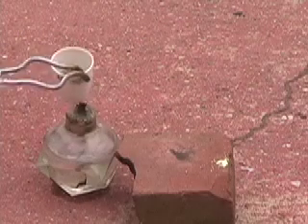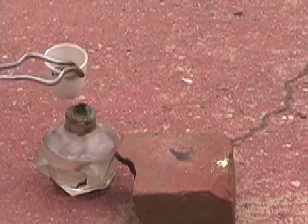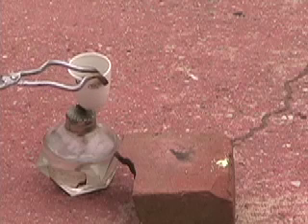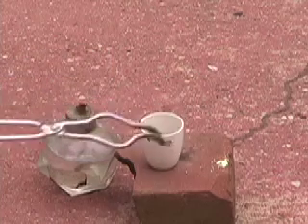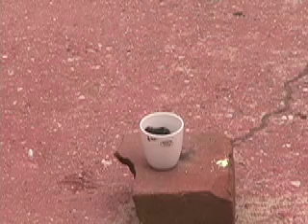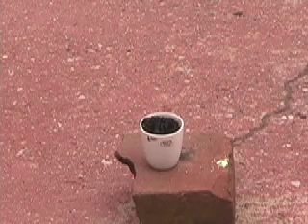You can start to see a solid mass rising up above the solution. Once this reaction gets going, it's quite exothermic, so I'll be able to stop heating it. And it'll just go on its own. It's off-gassing, and you can really, really distinctly smell the smell of burnt sugar now.